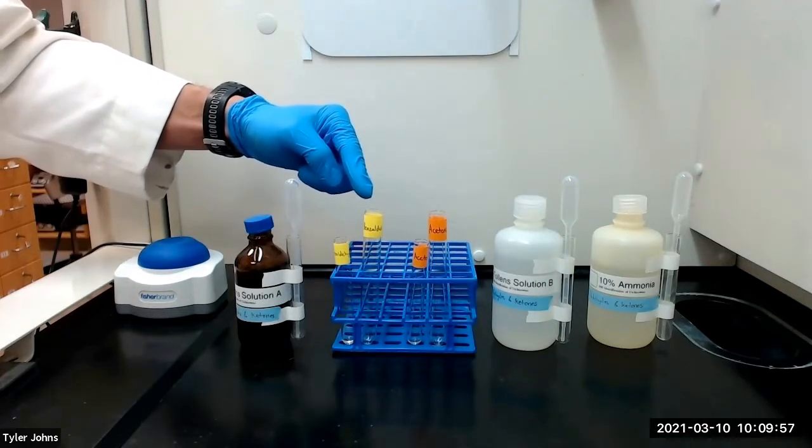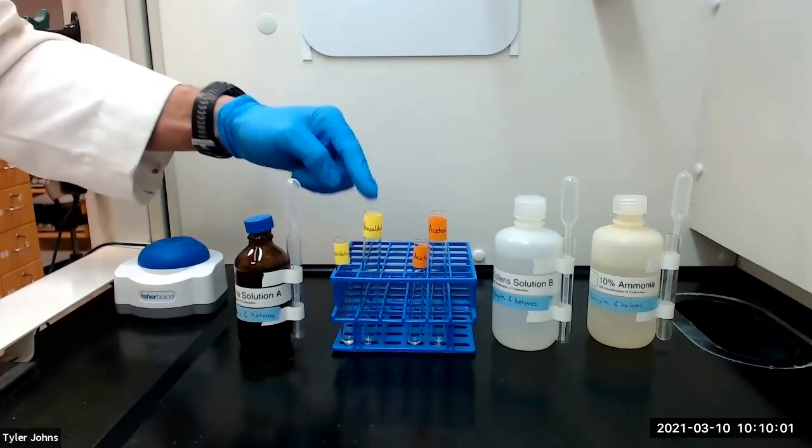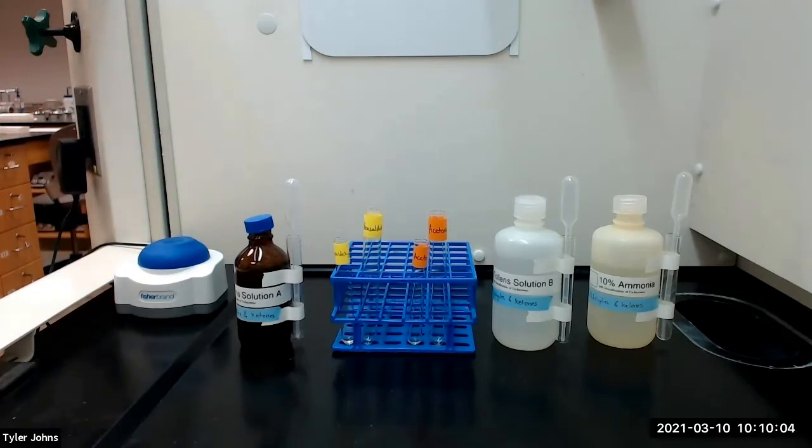Once the reagent is prepared, we will add our test compound solutions to the reagent mixtures and vortex. If a mirror of silver is deposited on the inner walls of the test tube, it indicates a positive test for the presence of an aldehyde.